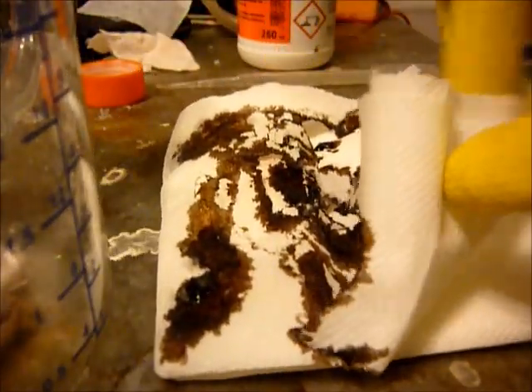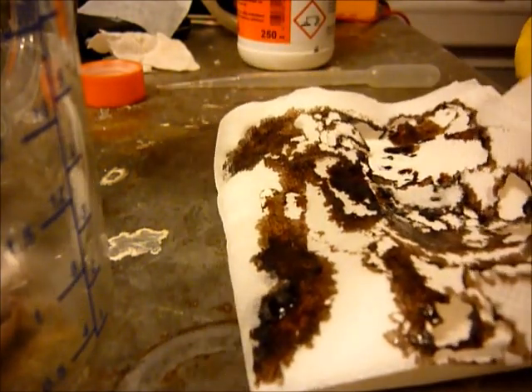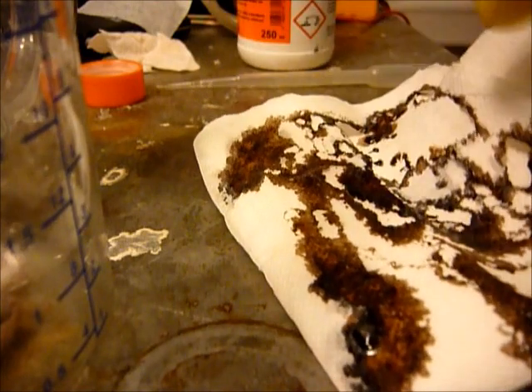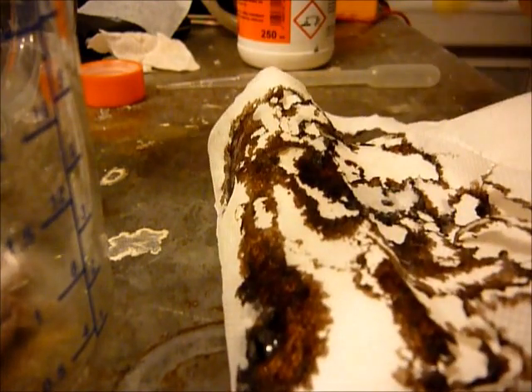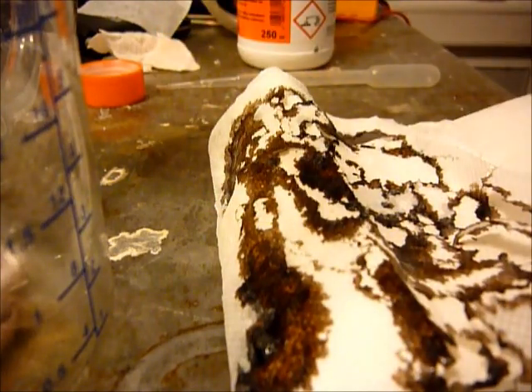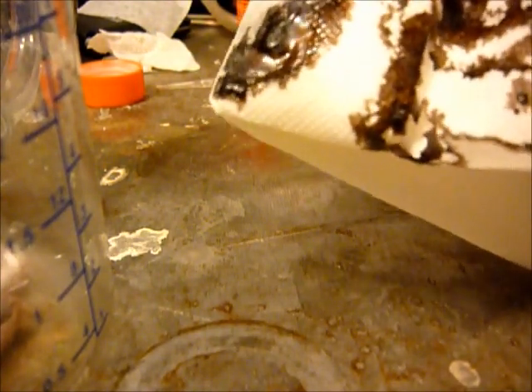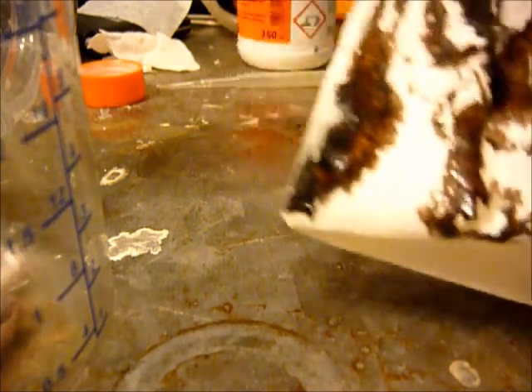It's not very easy to handle because this gooey paste is very corrosive. My gloves are contaminated with it. Basically, the whole paper is etched by sulfuric acid.